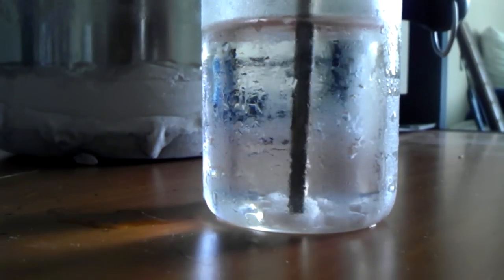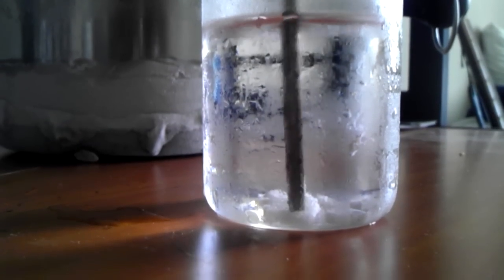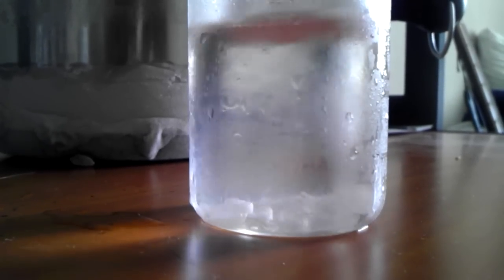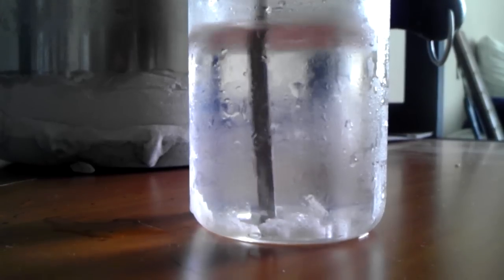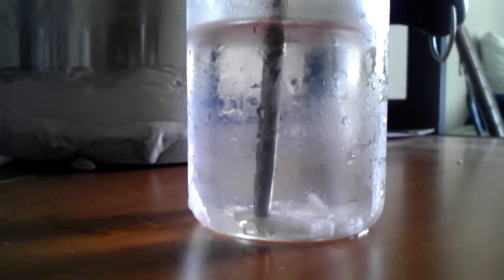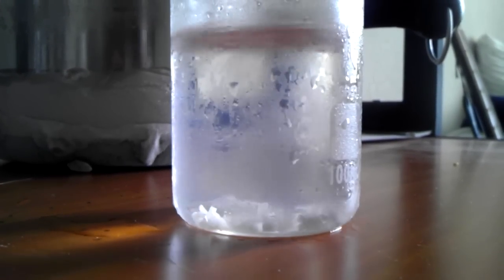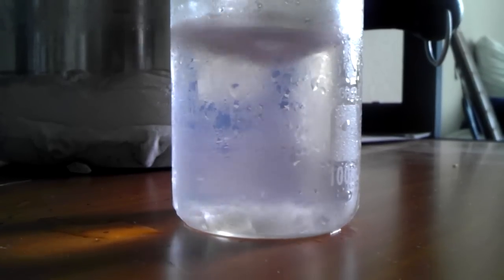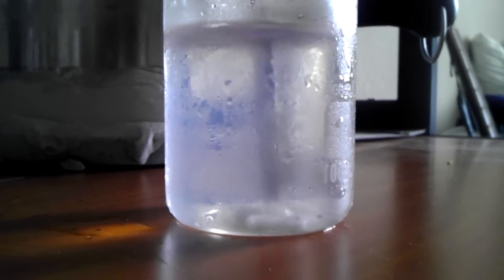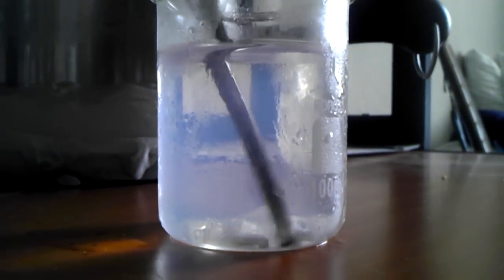You must stir the mixture. You'll notice the liquid will become cloudy and yellow-colored. Sodium hydroxide is some hard stuff. Now, you can see the liquid starting to become opaque.